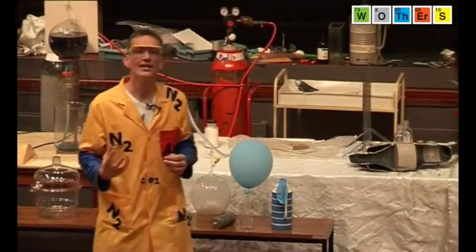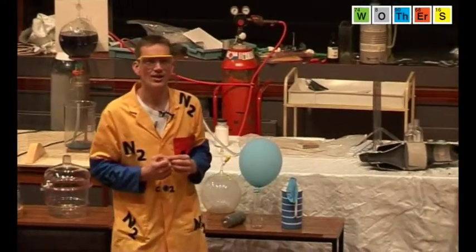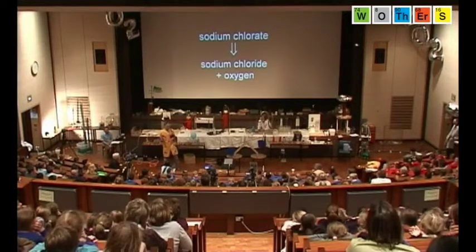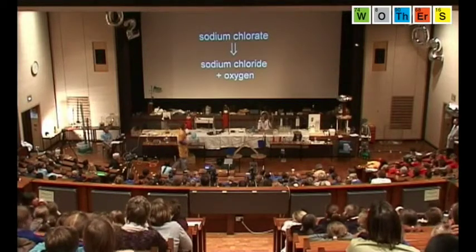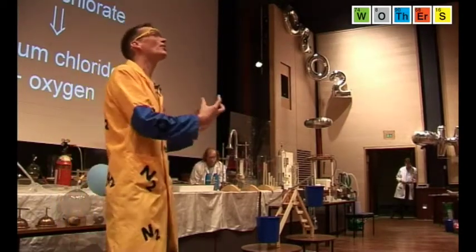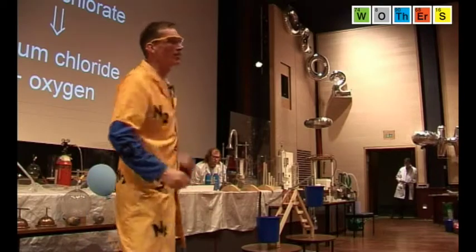Sodium chloride is, well, does anyone know what sodium chloride is? What's that? Yes? It's salt. Very good. Yes, this is actually the sort of thing that you'd put on your fish and chips. Just normal salt. Sodium chlorate is very different. This has oxygen built into it. You heat it up, it forms sodium chloride and releases the oxygen.